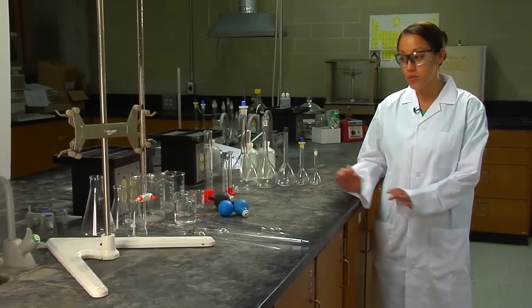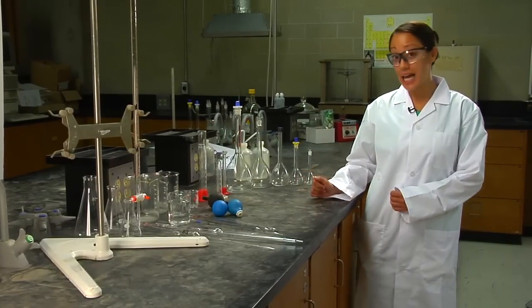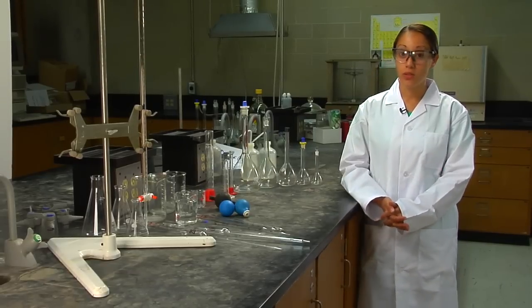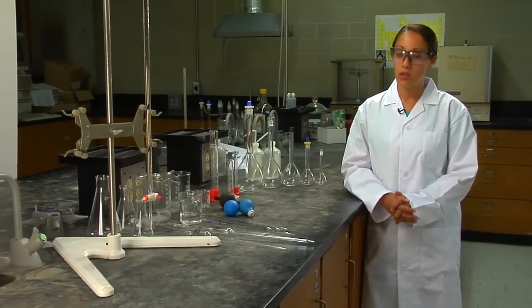Now that you're familiar with all the types of glassware that you'll be using in this lab, I'm going to show you how to do a quick easy dilution which you'll be using to make all your standard solutions and all your unknowns.